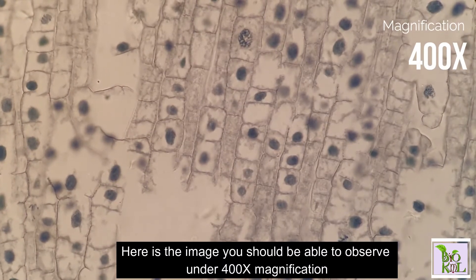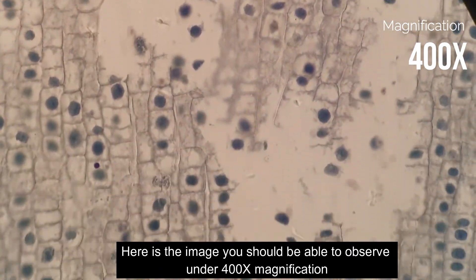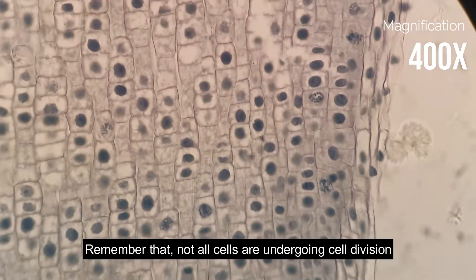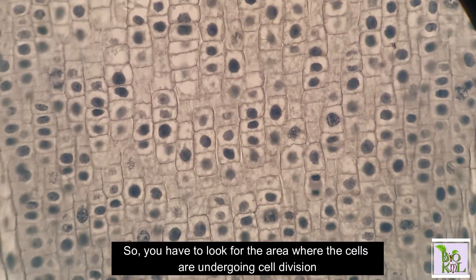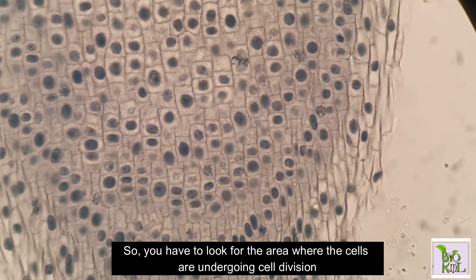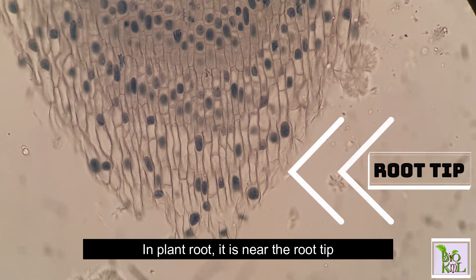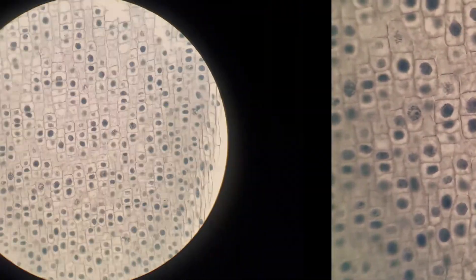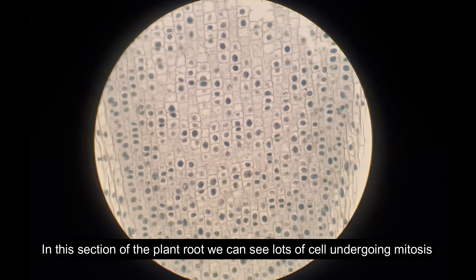Here is the image that you should be able to observe under 400 times magnification. Remember that not all cells are undergoing cell division, so you have to look for the area where cells are undergoing cell division. In plant root, that area is near the root tip. In this section of plant root, we can see lots of cells undergoing mitosis.